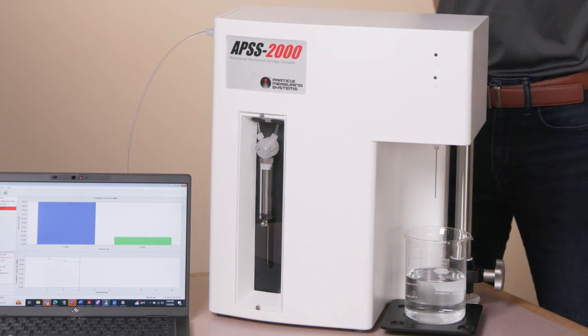We offer blunt tubing, blunt needles, and coring needles, all with Luer Lock compatibility.